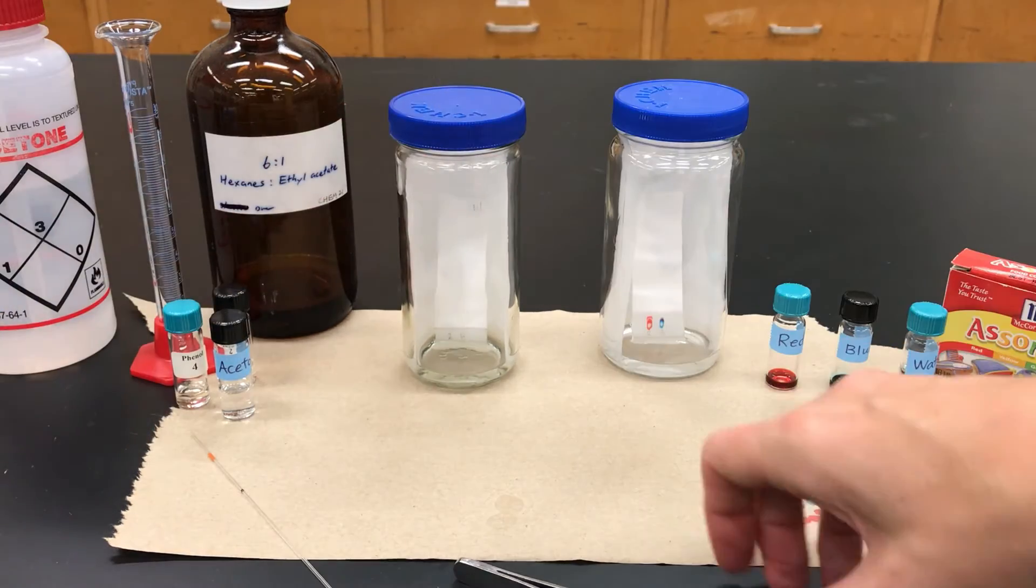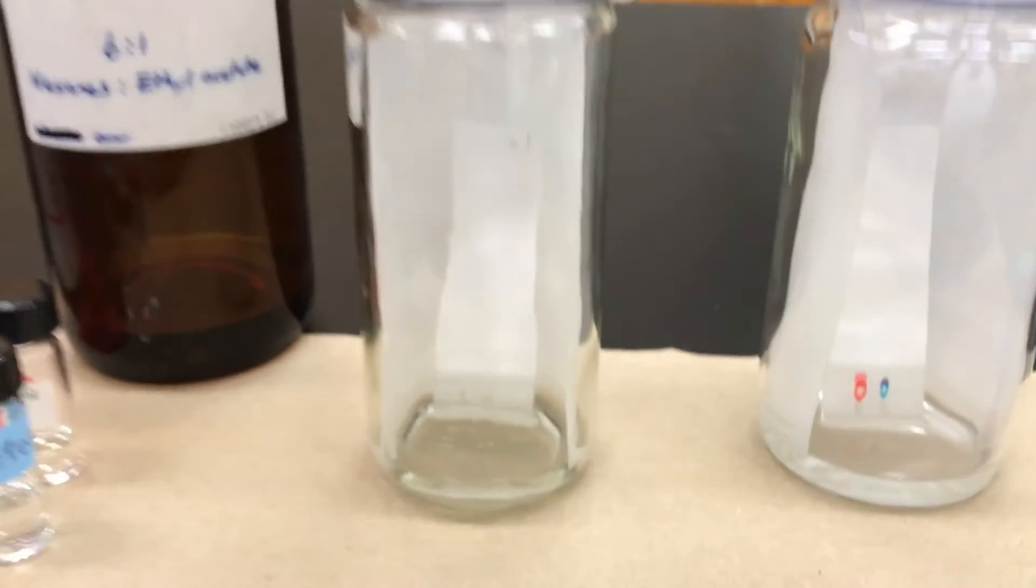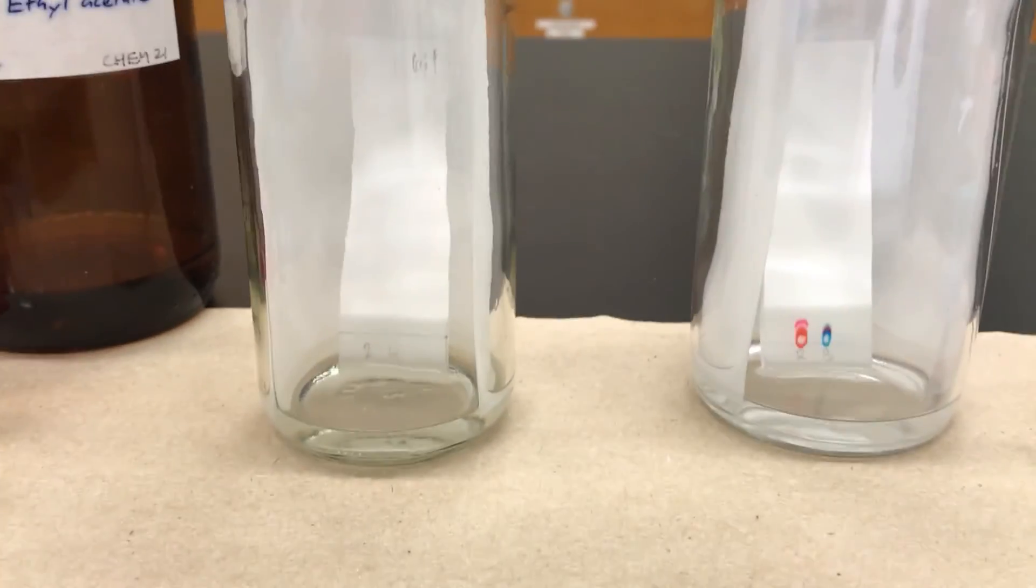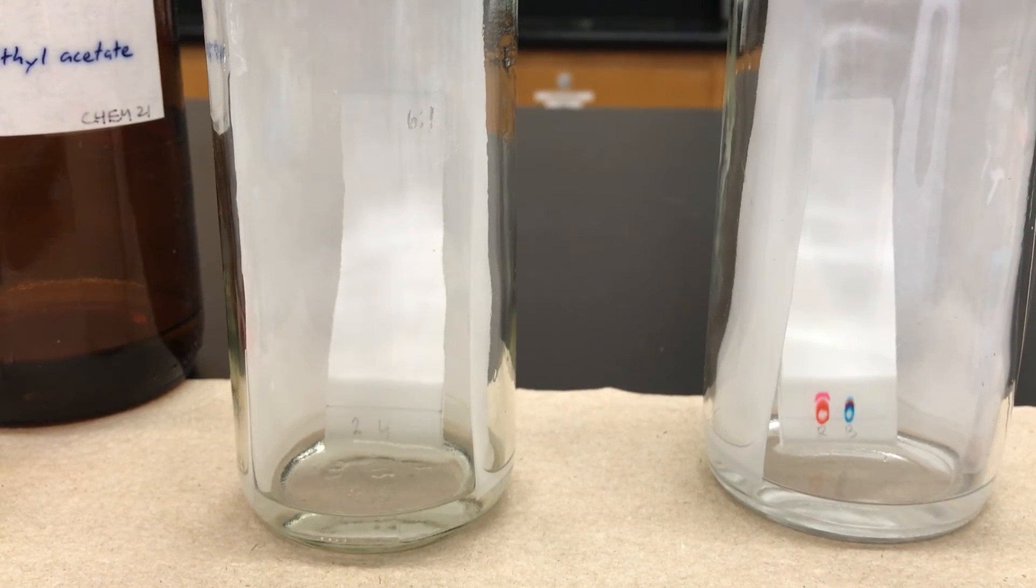And I let it run. So again, don't pick it up. Just leave it there. Let it go until the solvent front, which is that wet mark that is traveling up, until it gets close to the top.